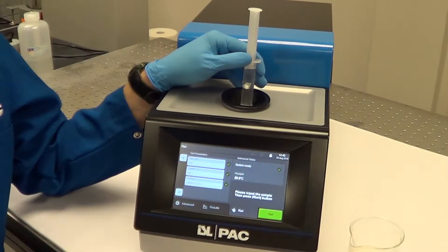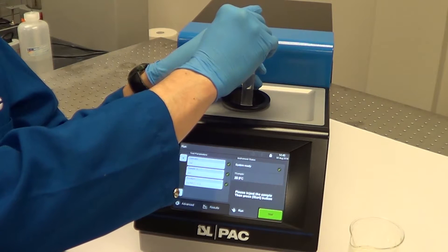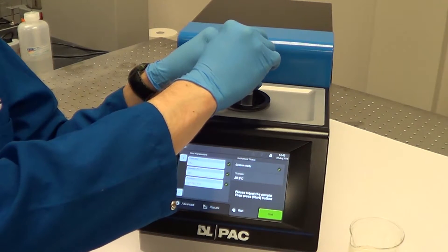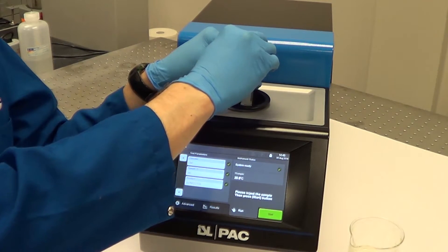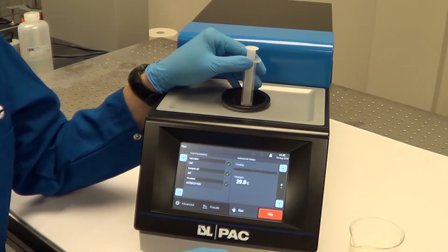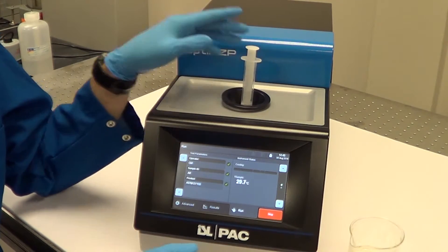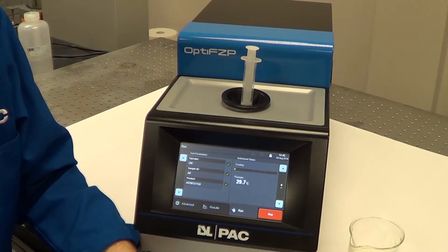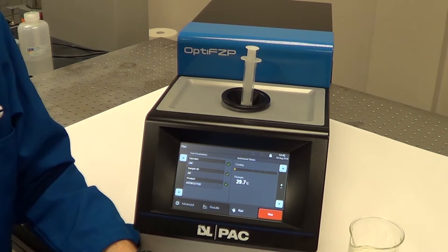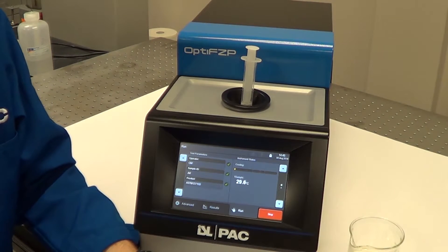Alright, and for completion of a test, we're going to inject a new sample. We're going to press start, and this time we're going to let it run. In approximately 15 minutes or so, we'll have our number. Once it's completed, I'll show you the results menu.